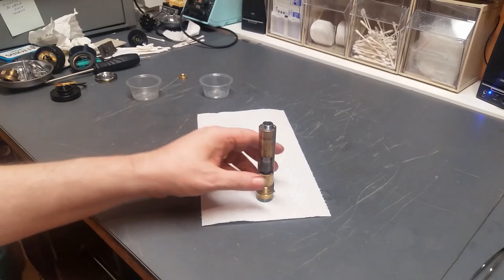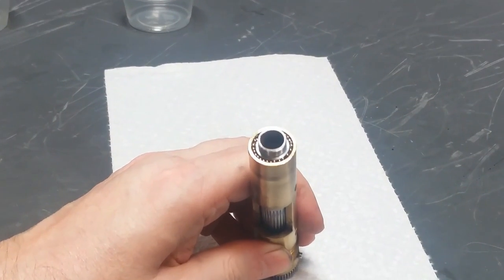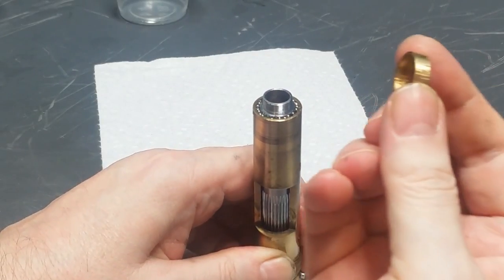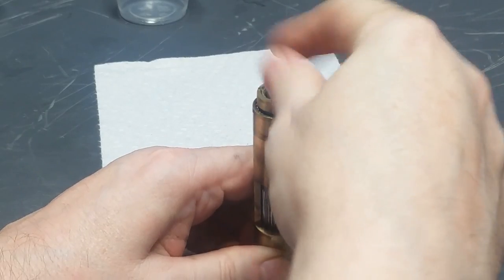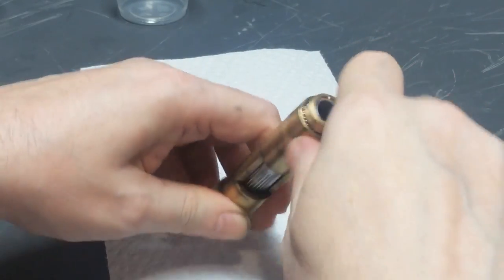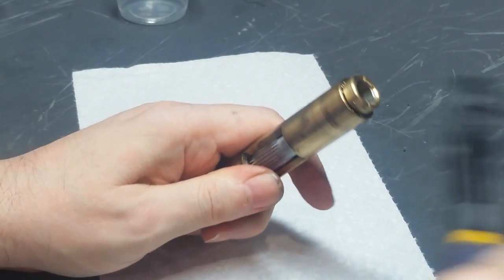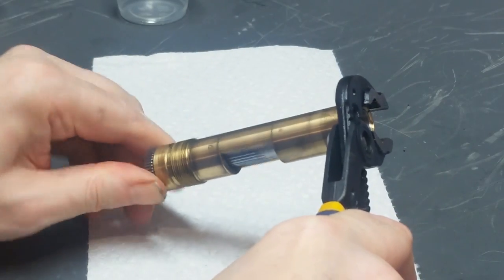Okay, I've got all 30 of them in place in the top grease there. And what remains is to put this nut on here. Thread it down. And sometimes it goes easily, sometimes not so much.